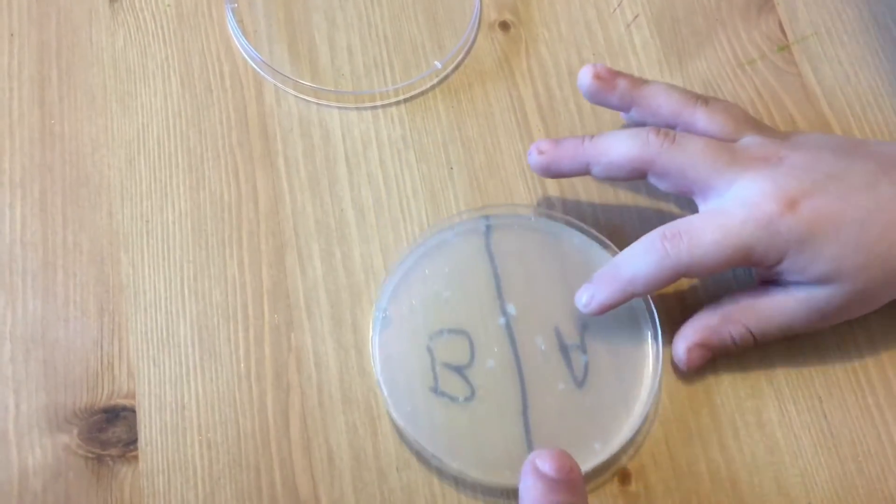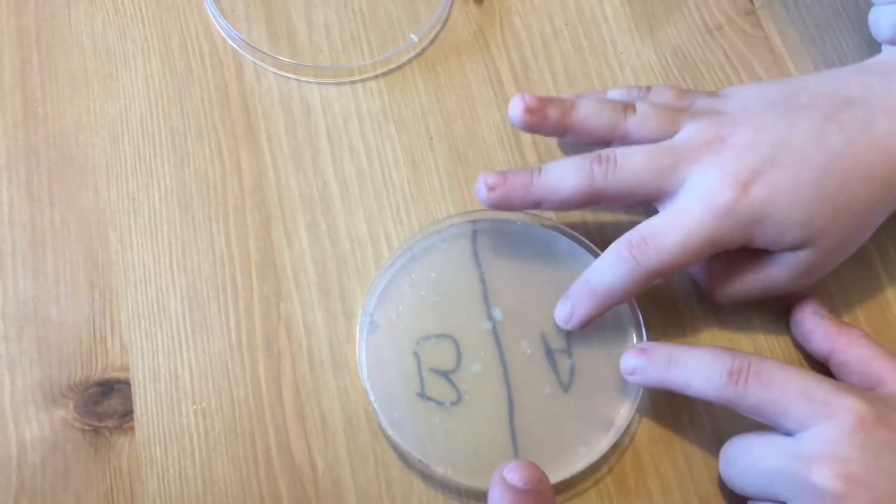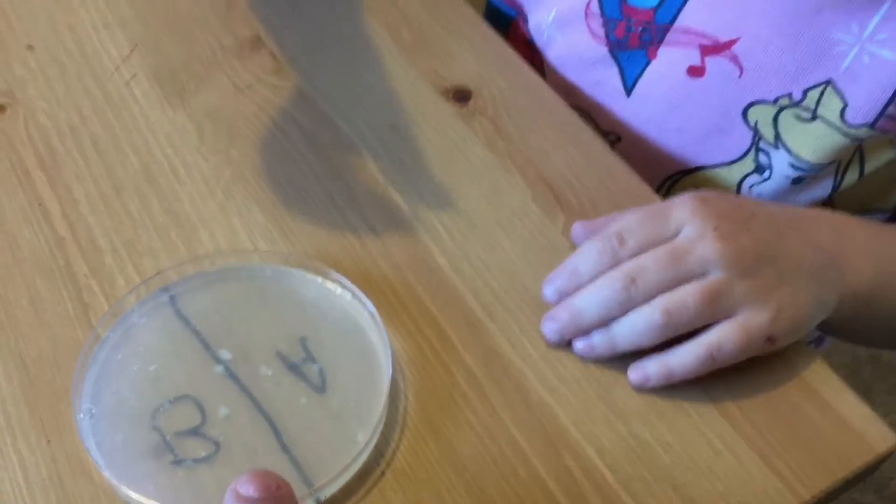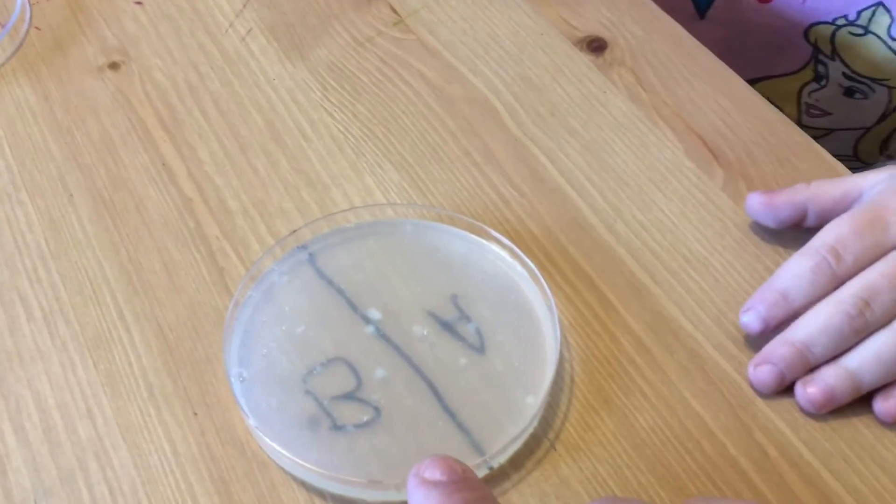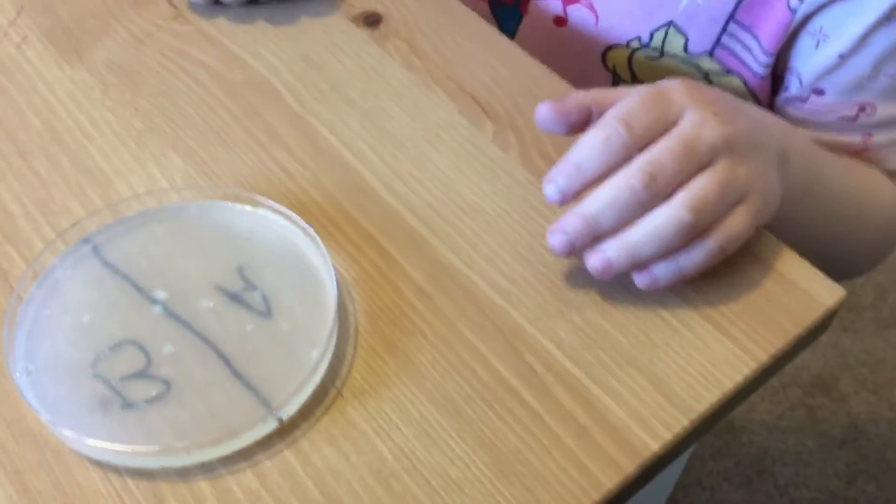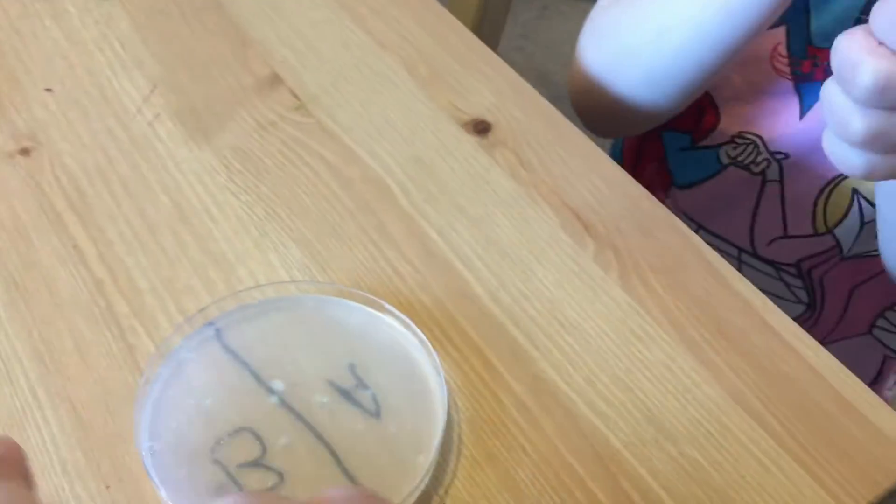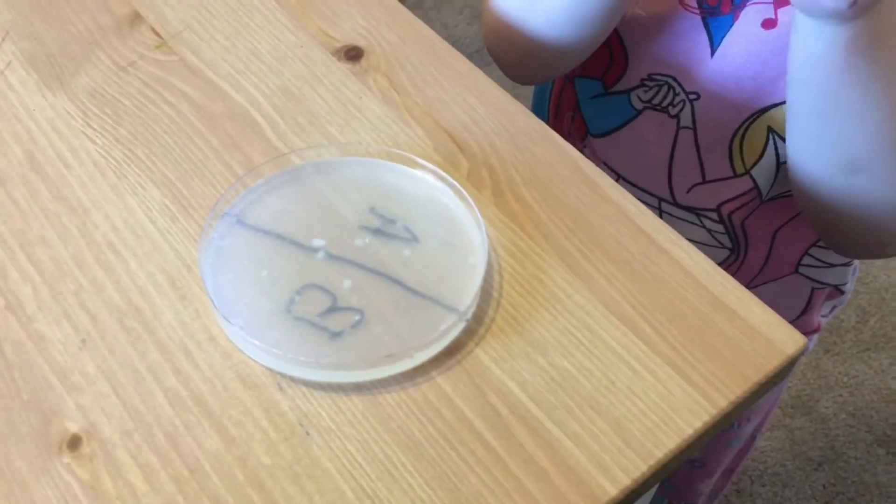Gentle, gentle, stay on the A side. There we go. What do you think? What does it feel like to you? Jello. It feels like jello. It feels like squishy jello. Yeah, why don't you use that thumb that you suck? Yeah, I want to see what grows off of that. Which one you suck on?